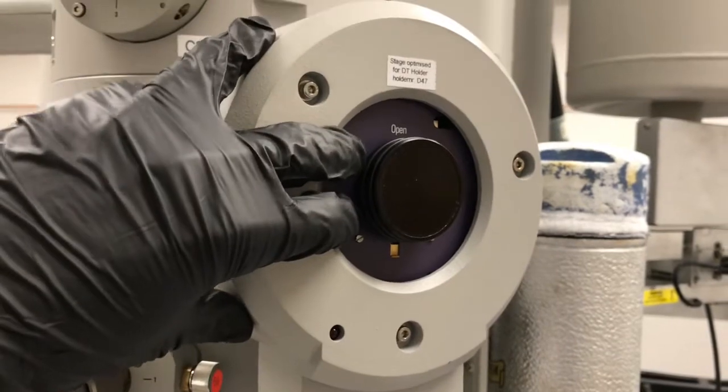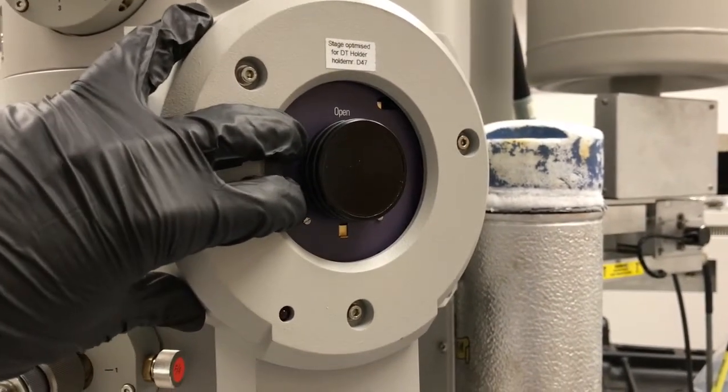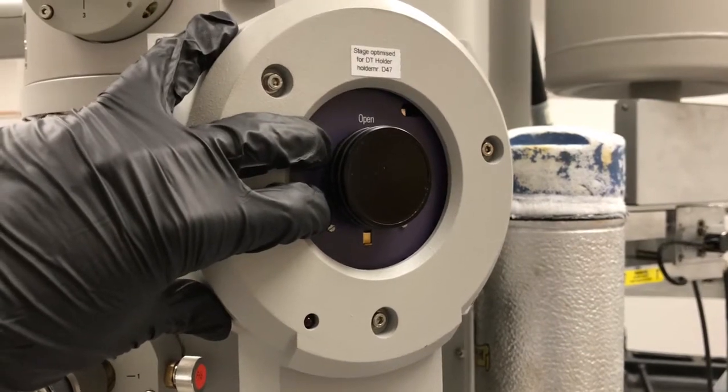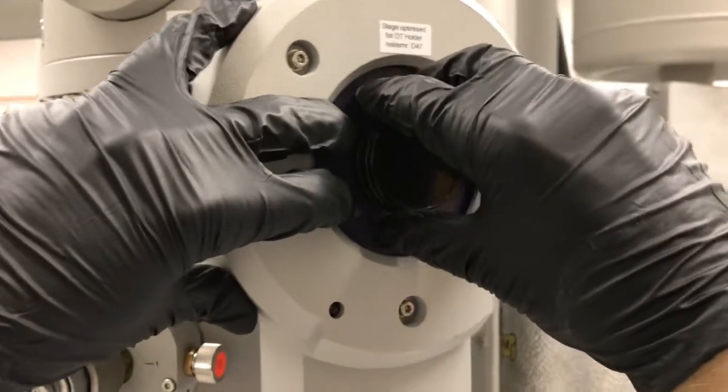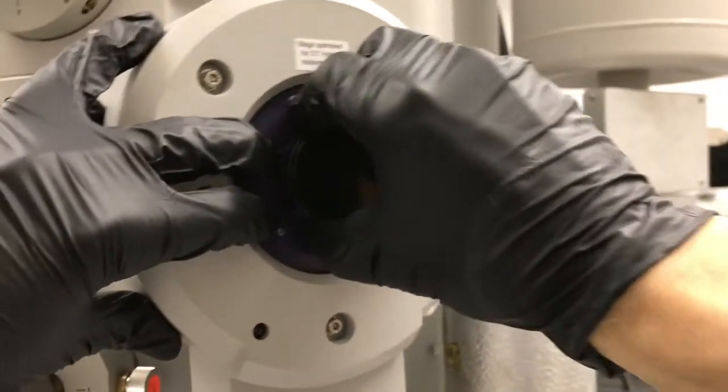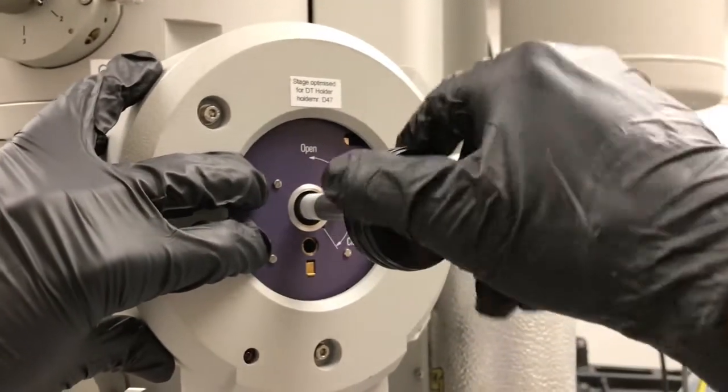I'll go ahead and demonstrate this. So I'm pushing against here, it doesn't have to be hard but you need to apply some pressure while you're doing this. Take your right hand, pull, there's the stop.